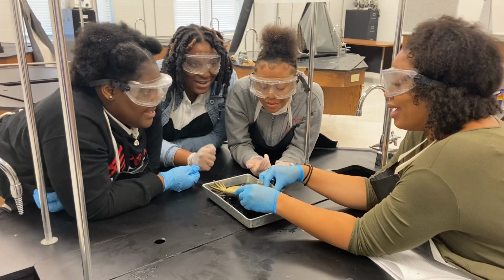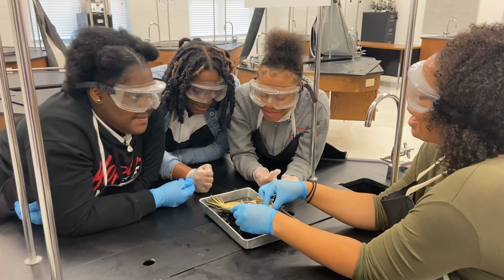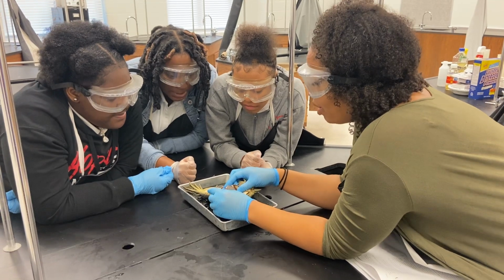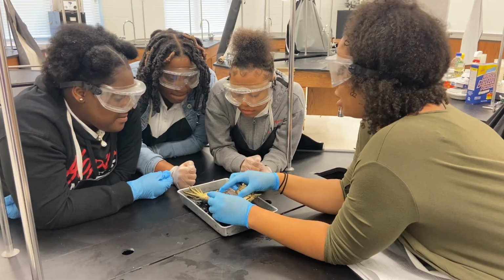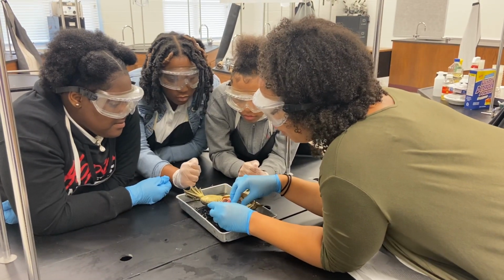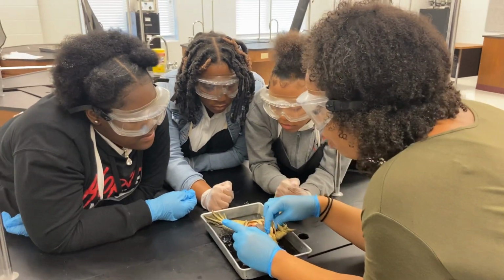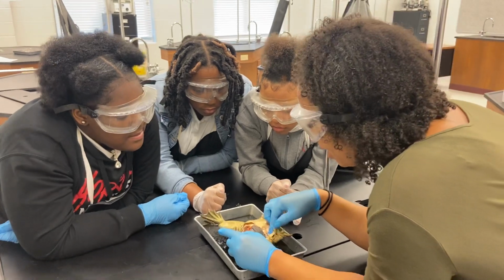Did you guys enjoy dissecting the frogs? Yes. It was all right. It was all right? Disgusted, but it was fun. But you actually reached out, you kind of went for it, right? Now you never know when you'll get another experience like this. So I'm proud of you guys for stepping out of your comfort zone and doing something that you initially came in here and said, oh my gosh, I'm not even touching that thing. But you guys got it.